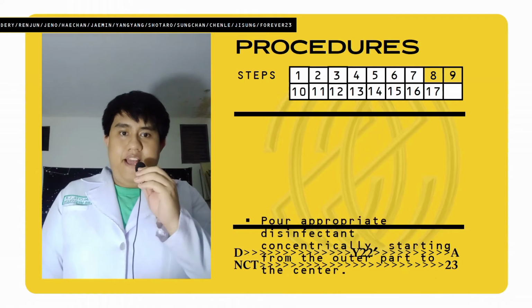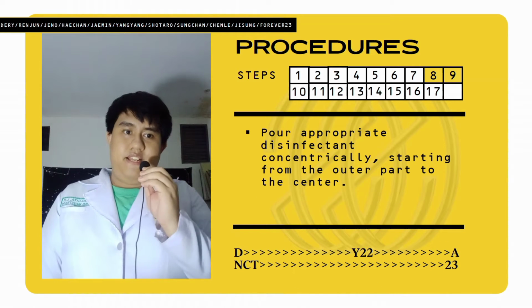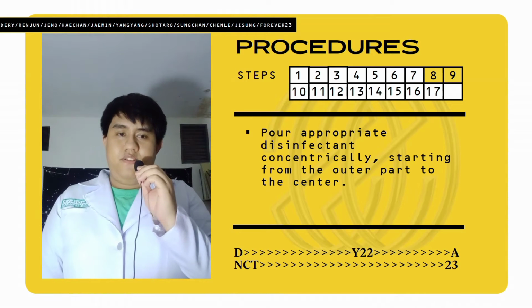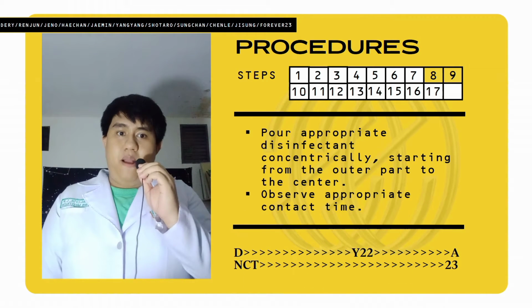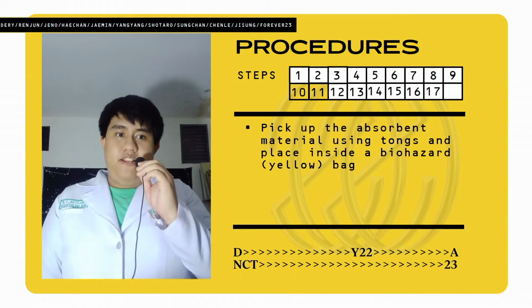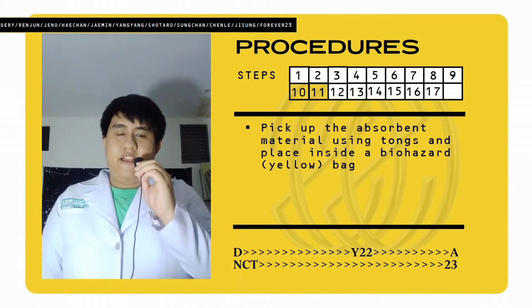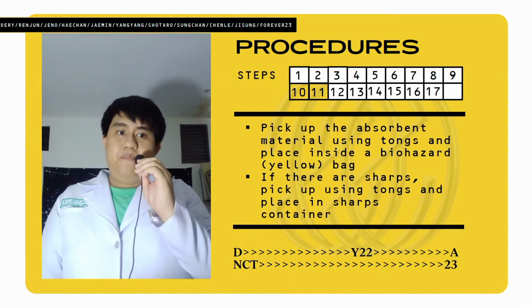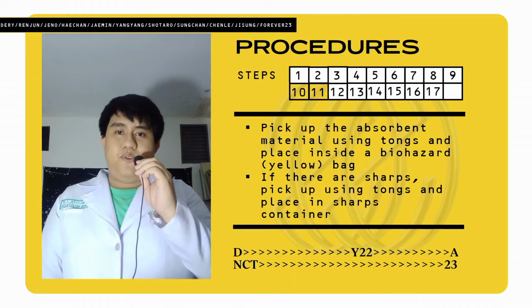After all that, we have to pour appropriate disinfectant concentrically, starting from the outer part to the center. Next, we have to observe appropriate contact time. Pick up the absorbent material using tongs and place inside a biohazard yellow bag. If there are sharps, pick up using tongs and place in a sharps container.